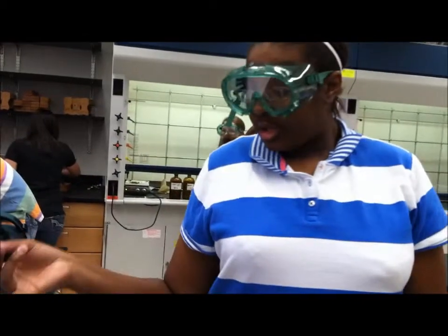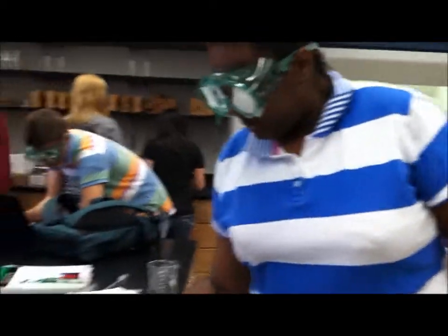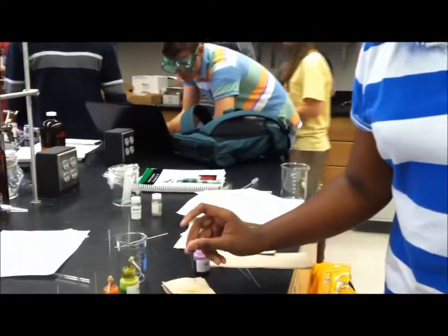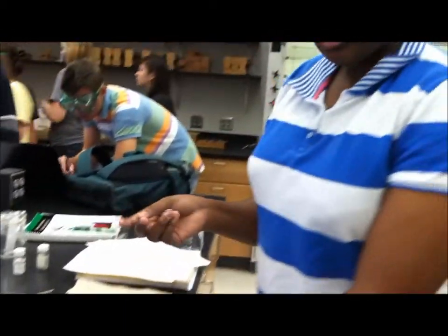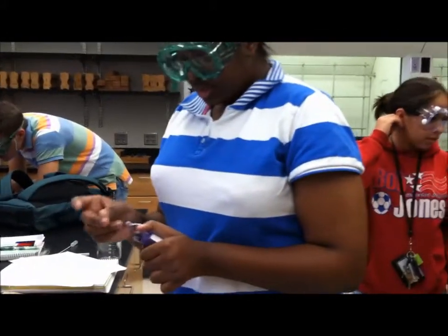All right, so what we are going to do is we are going to continue spotting our paper. If you come closely, I've already spotted a few solutions. So my last spot will be our unknown solution. So I'm going to place our capillary tube.